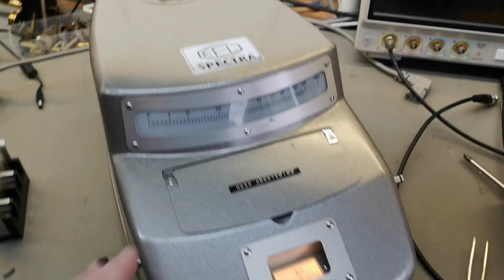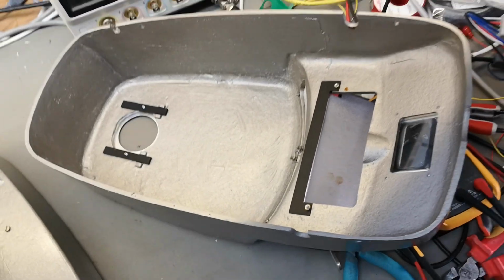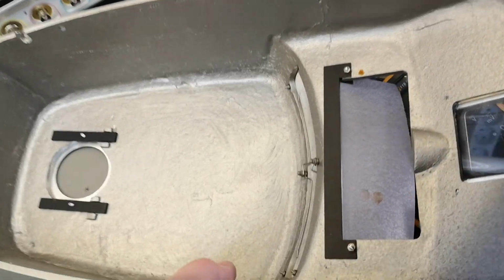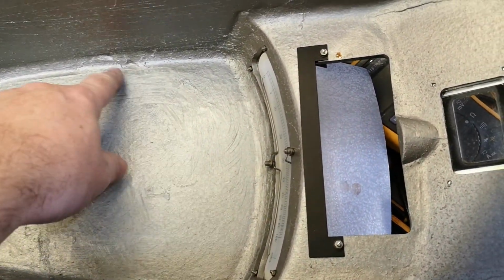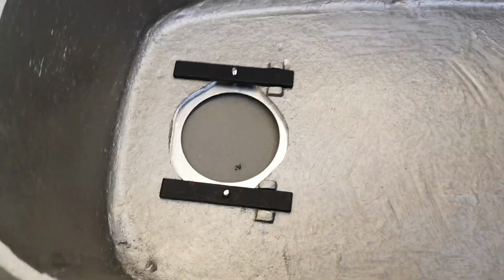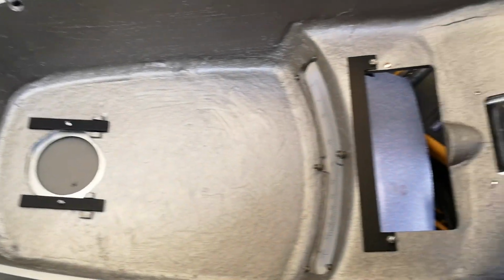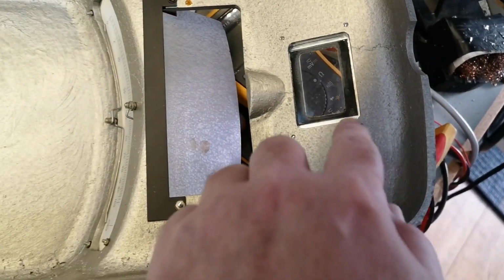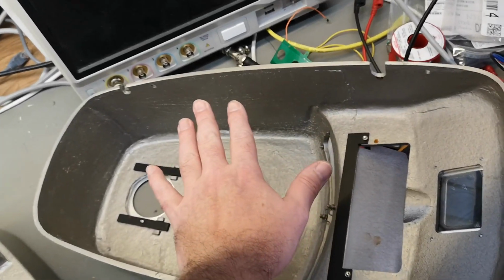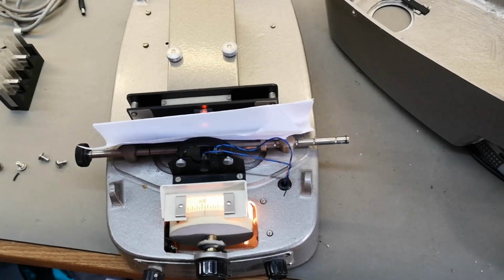I'll try and take off the lid and see if there's a missing bulb. So now we're inside. So this is aluminium. This is casted aluminium. But look at the way that they made the casting. And that hole. Wow, that is really weirdo. But anyway. So this is the inside, this big case. See, with my hand here, it's really big. But the interesting stuff is this.